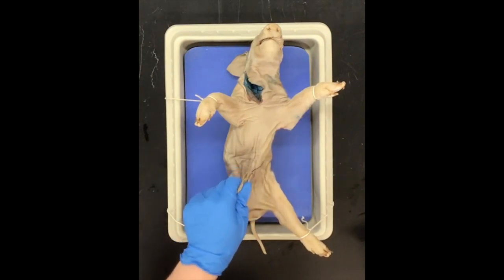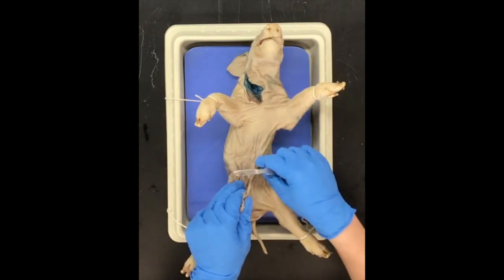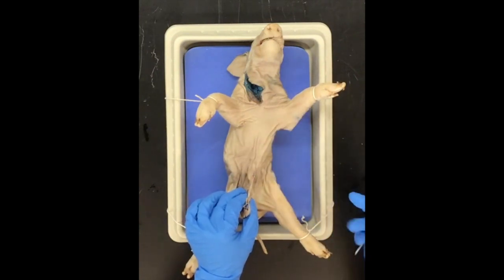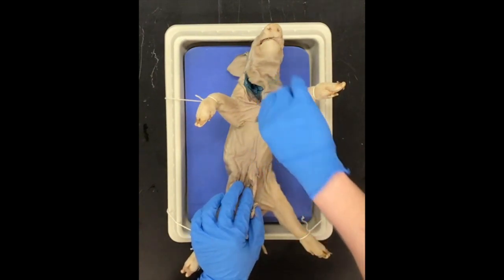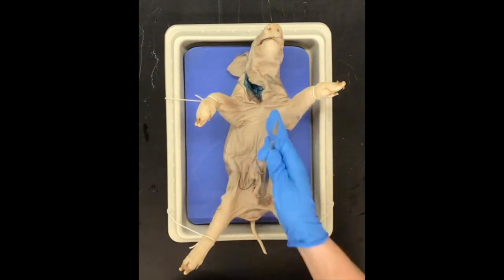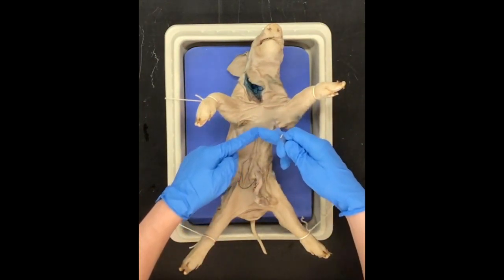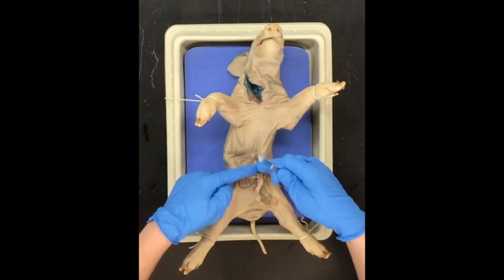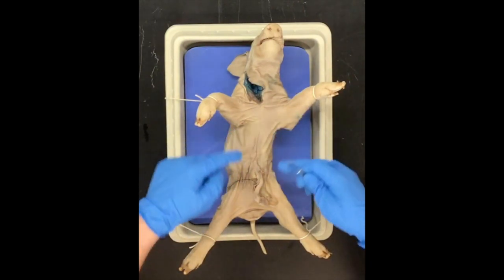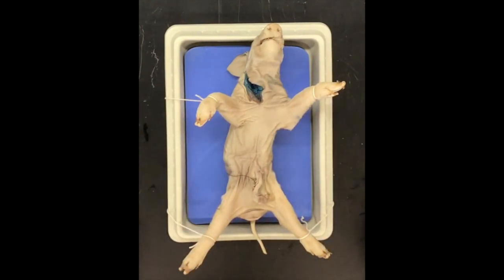We're going to lift up on the umbilical cord and cut just above it with our scalpel — this little knife thing is called a scalpel. So we're going to cut just above the umbilical cord and make a small incision. Once we make that small cut, we are going to cut up — a vertical cut through the abdominal cavity and into the chest cavity. Right when we start to hit the rib cage, we are going to make two incisions going this way, right underneath the front legs, and two incisions right above the back legs. So we're going to go ahead and speed up this video for the dissection.